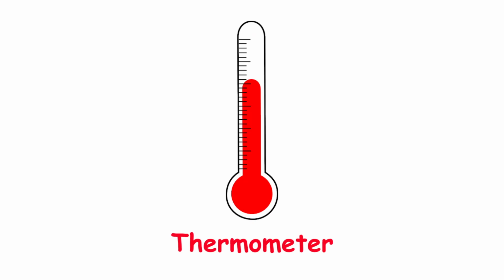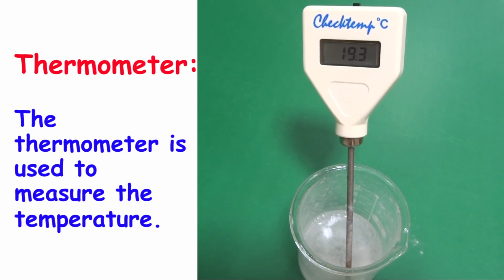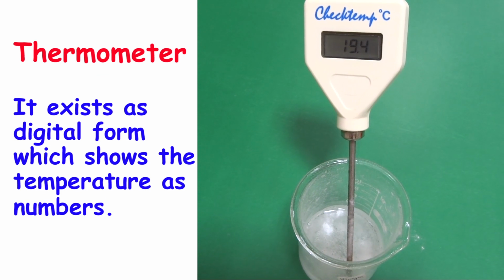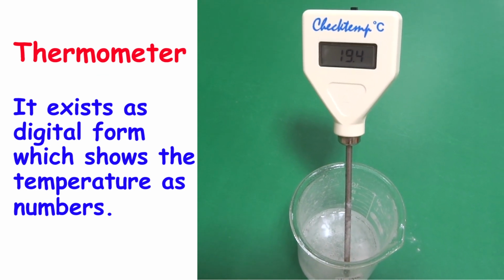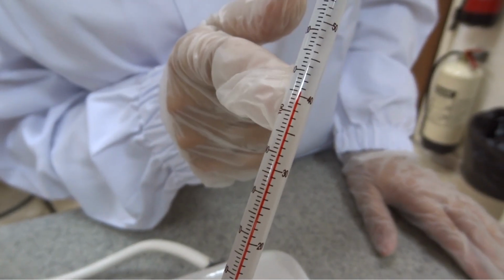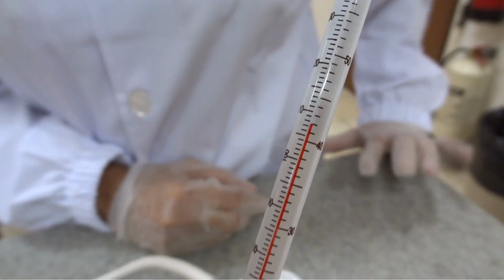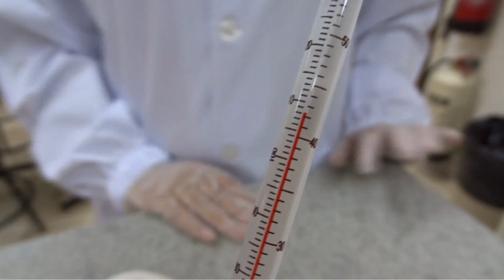The thermometer. The thermometer is used to measure the temperature. It exists in digital form, which shows the temperature as numbers, or the traditional thermometer which contains mercury or alcohol. The liquid will proportionally expand due to heat and show the temperature accordingly.